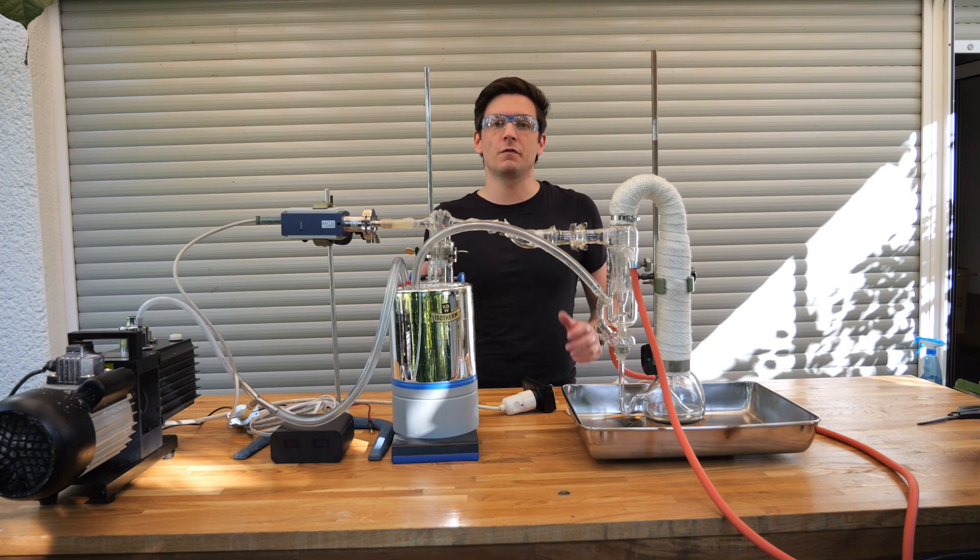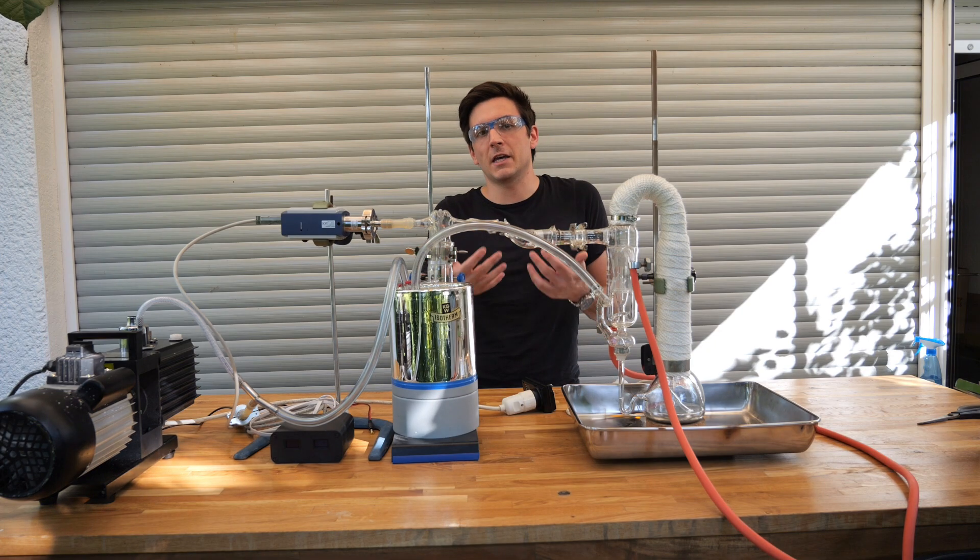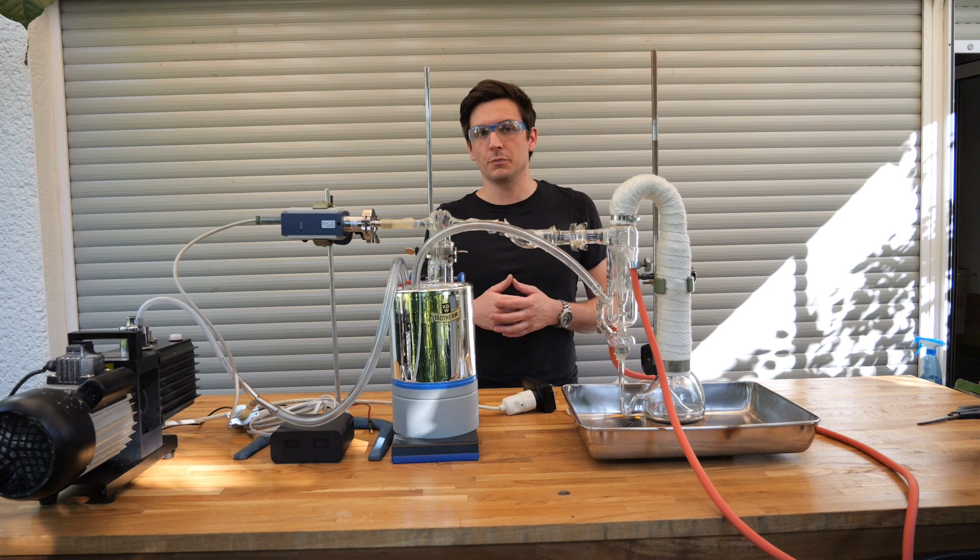Approximately eight months ago I made a video about vacuum diffusion pumps, or my vacuum diffusion pump. It was an oil-based vacuum diffusion pump.